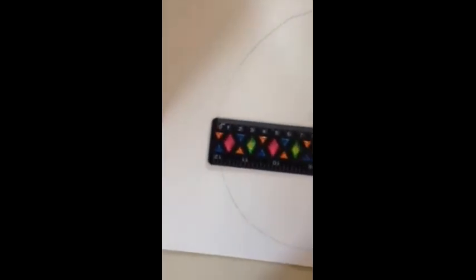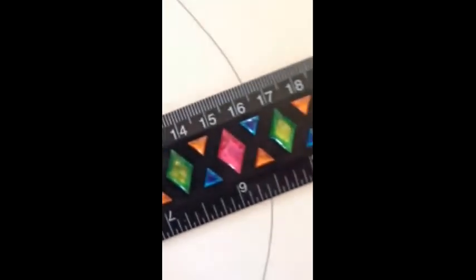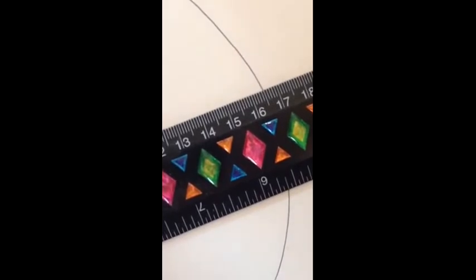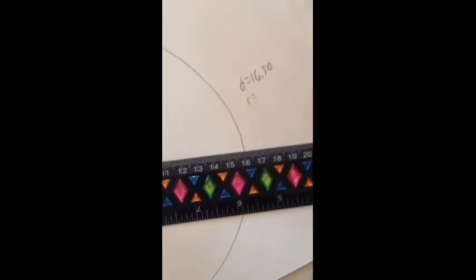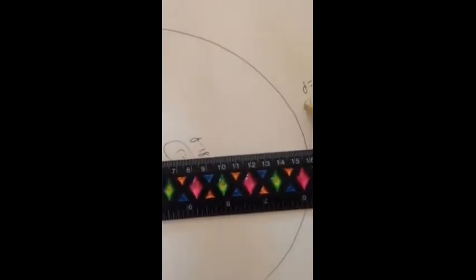And let's measure the radius in the other direction. Lining up 0 with one end, and then taking our reading from the other end. 16.50 I would say. So it looks like it's right on the 5. It's not more, it's not less. So 16.50. Which makes our radius 8.25 if we divide that by 2. Alright, so we have 2 other radius measurements to average into our final answer here now.